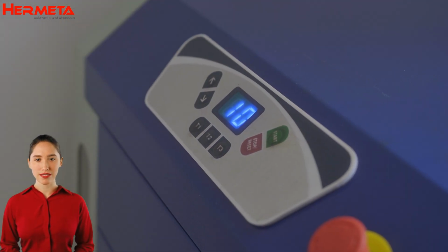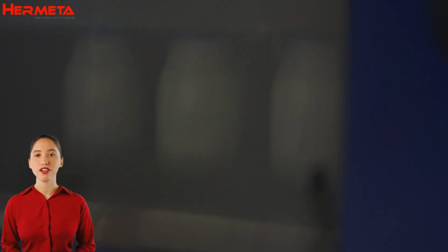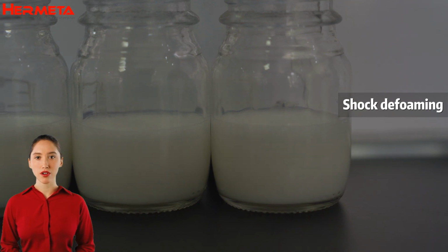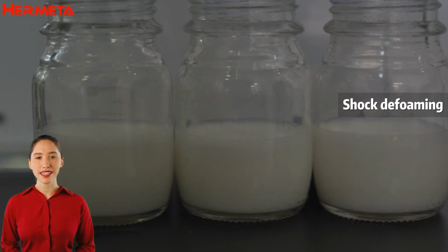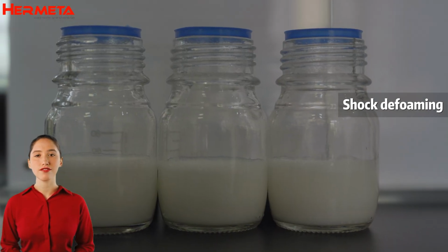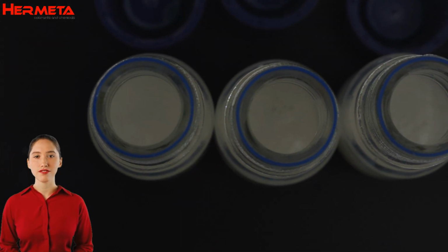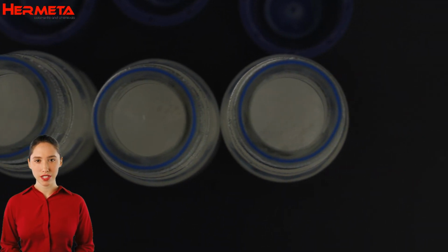During the vibration process, the generation and dissipation of bubbles in the pigment solution are observed, and the experimental results are recorded in detail. By analyzing the data, we will evaluate the effectiveness of the pigments in the coating and printing industry, ensuring that the final coating has a smooth and flawless surface.